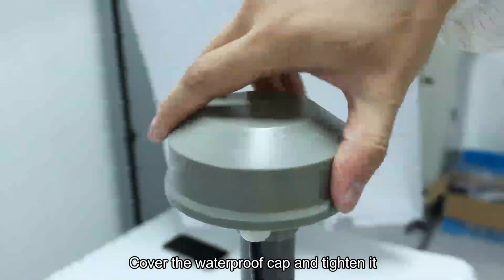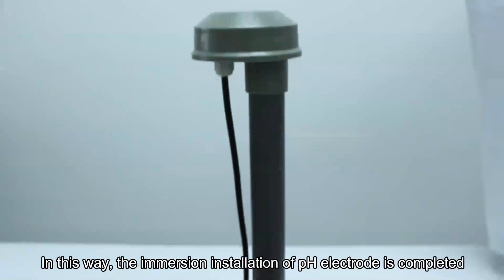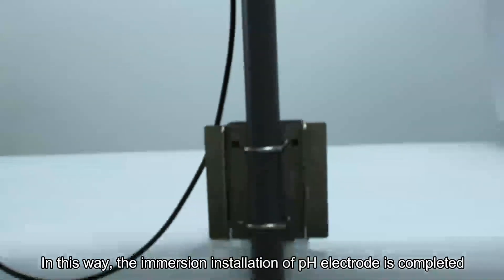Cover the waterproof cap and tighten it. The immersion installation of pH electrode is completed.